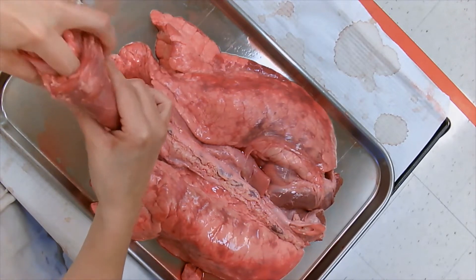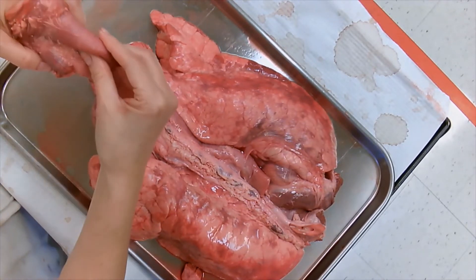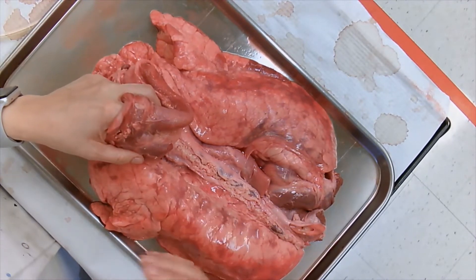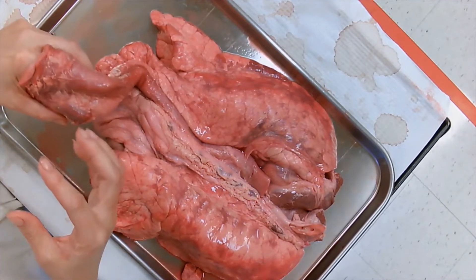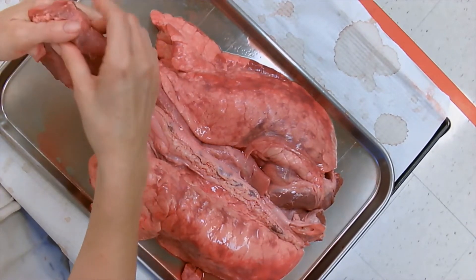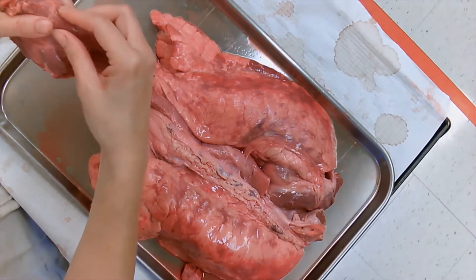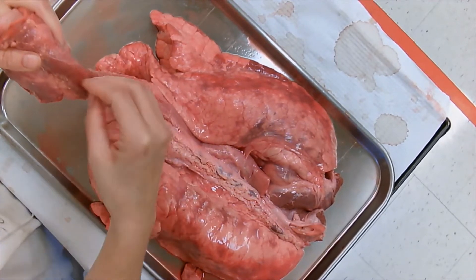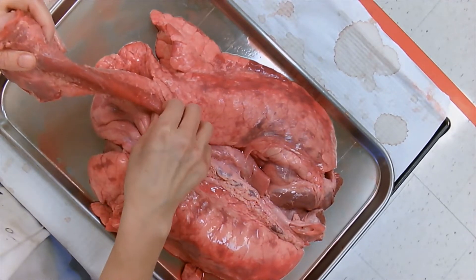The esophagus is right here in the back. As you can see I can actually put my finger in and it slides all the way down. Now when you eat food and swallow it, it's not called food anymore — it's called the bolus. The bolus goes inside the esophagus.